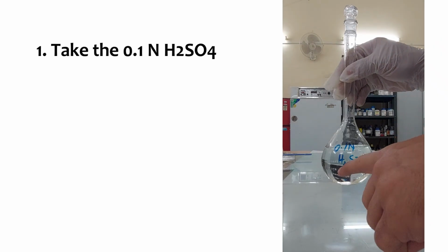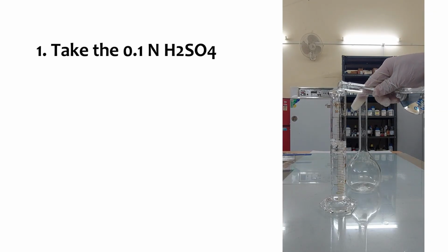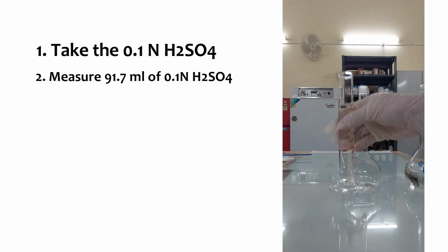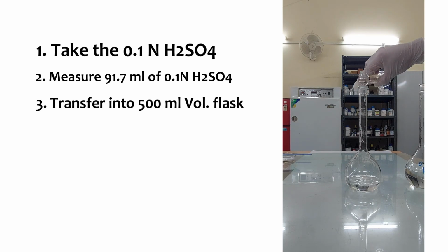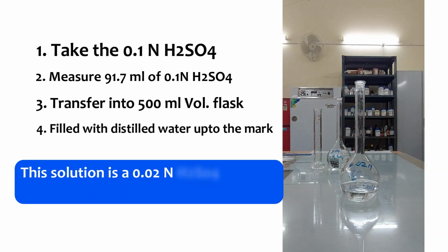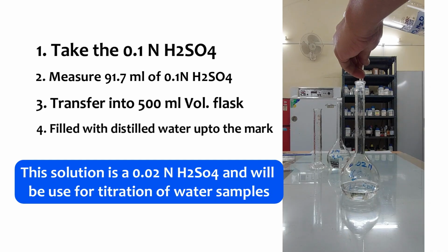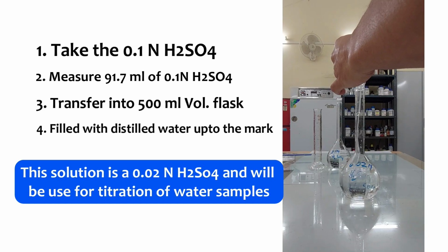Okay, so now we have obtained that in our calculation. Now let's do it. First, take the 0.1 normality sulfuric acid and measure 91.7 ml of it, transfer it into a 500 ml volumetric flask, and then fill the volumetric flask with distilled water. This final solution that you obtain is the standard 0.02 normality sulfuric acid, and it will be used for titrations of the water samples.